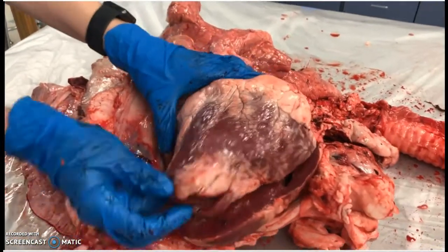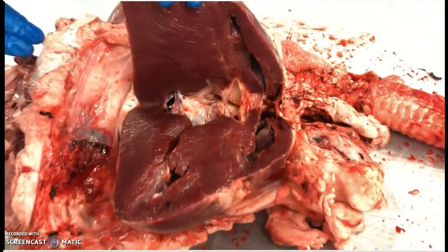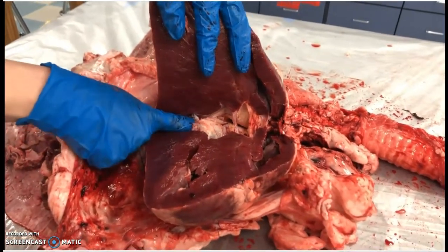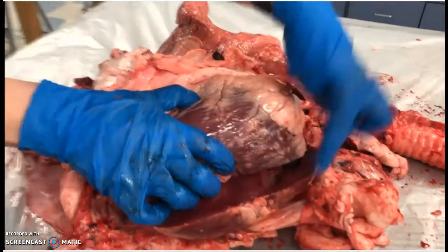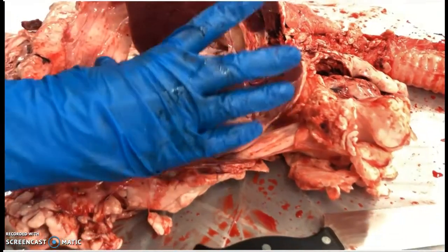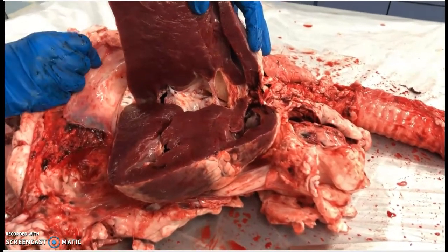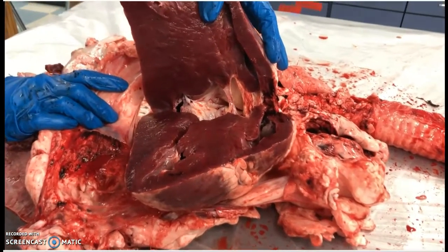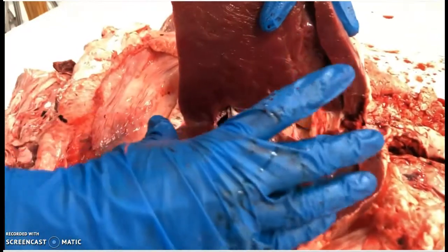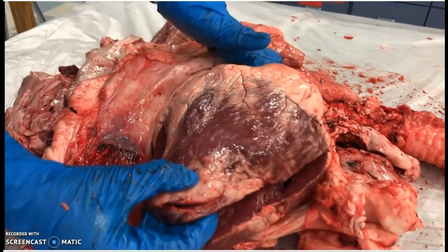Inside the heart, you have valves. These white structures are the valves. The valves are between the atrium and a ventricle on each side, and there's also a valve after blood leaves the ventricles. When the heart contracts and squeezes blood out of the ventricles, there is a valve between the artery and the ventricle. A valve's job is to prevent backflow of blood into the heart. They snap closed whenever a contraction happens, so blood doesn't go backwards into the atrial chambers.